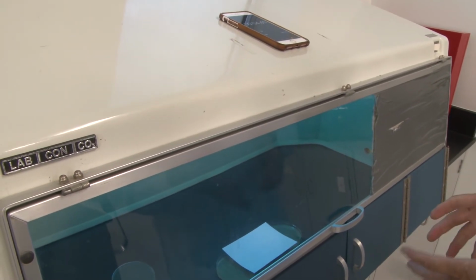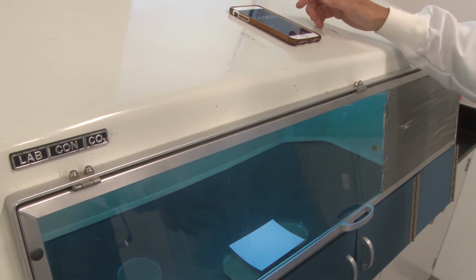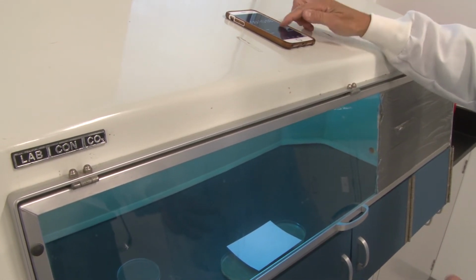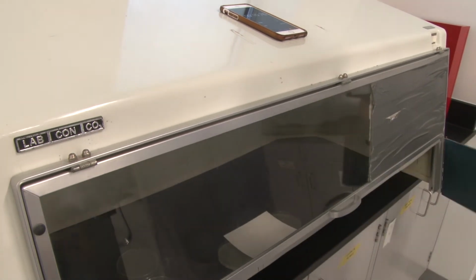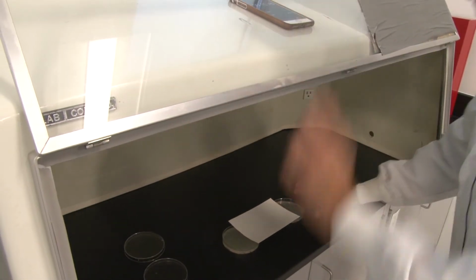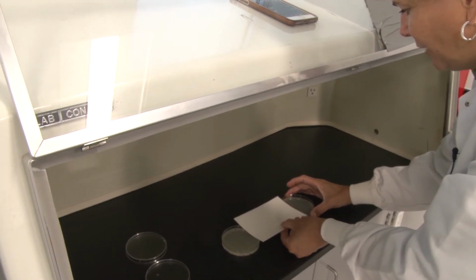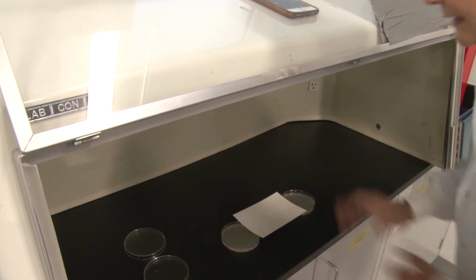Now, at the end of this period, the 60-second region will have been exposed for a total so far of 50. Okay, turn the light off. Whoops. Open it up again. Let's think before I start this up again. I'm going to move it out to the 10-second realm. And let's think about this.